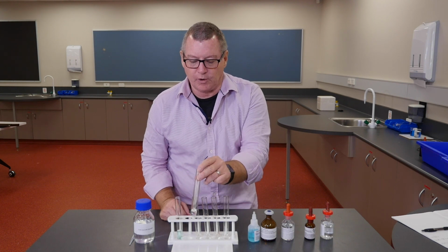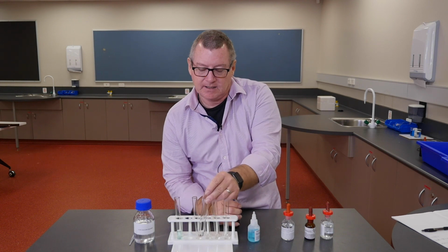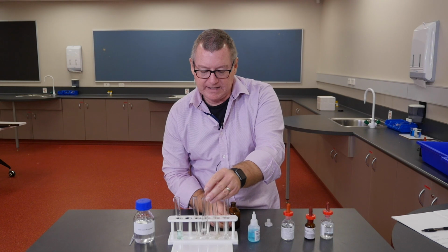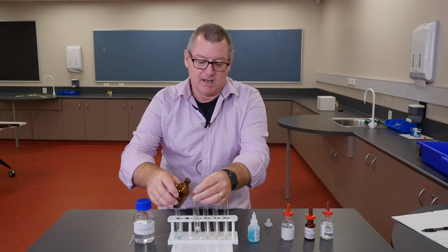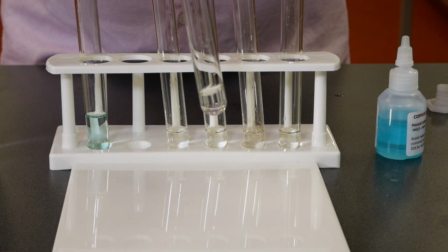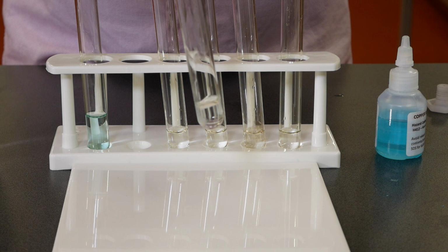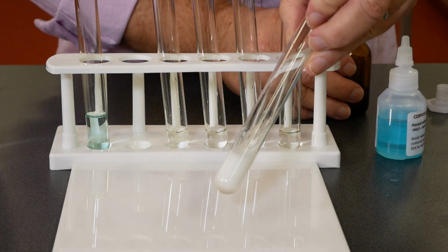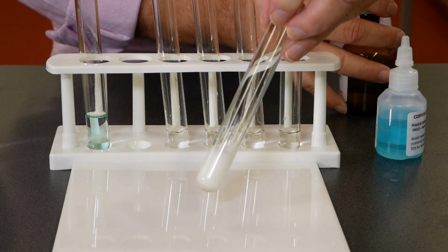So still calcium chloride in the test tube, but now silver nitrate. Again, same kind of deal. Either silver chloride is insoluble and causes a precipitate, or calcium nitrate. Now we know that most nitrates are soluble. So if we get a precipitate, and we do, a kind of chunky white precipitate, then we know that's a silver chloride precipitate.